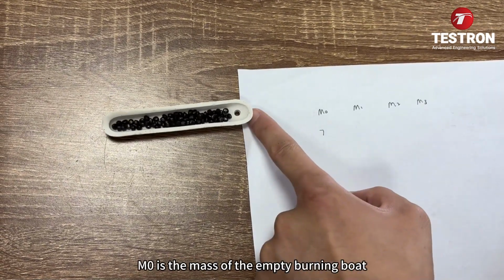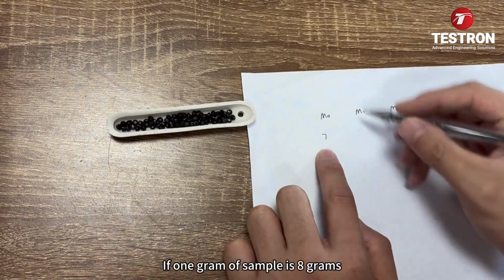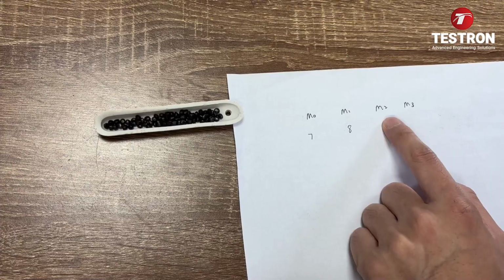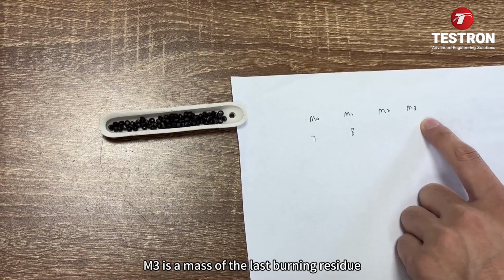M0 is the mass of the empty burning boat. M1 is the total mass of the combustion boat plus the sample. If 1 gram of sample makes it 8 grams, then M2 is the weight after the first cracking at 550 degrees. M3 is the mass of the last burning residue.